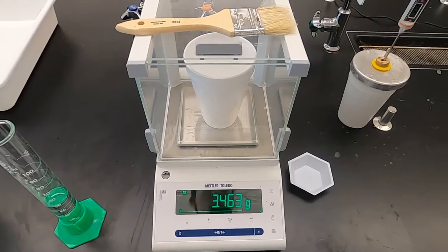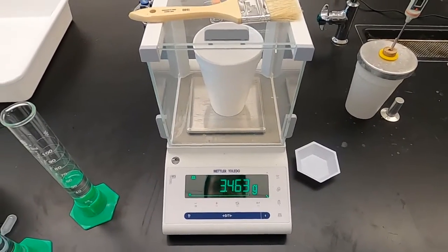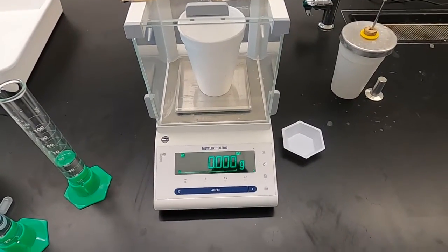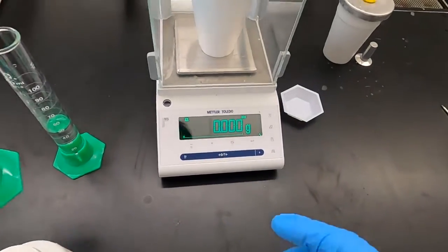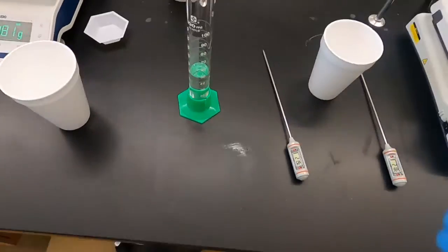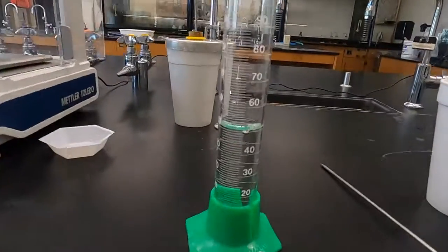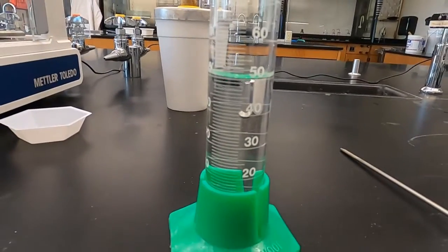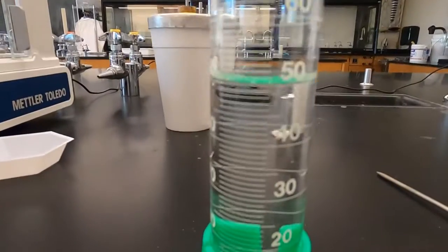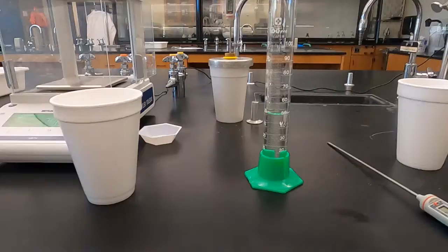And you're welcome to put down 3.463 grams to keep track of this math, or we can zero this out, pour our 50 mils of water in, and see what the actual mass of the water is, since that's the value we need to know. So, just like with before, I have pre-measured this 50 mils again. We're going to look at where this meniscus is. Where is our level? Somewhat hard to see the line, but that is about as good as 50 mils as we can.